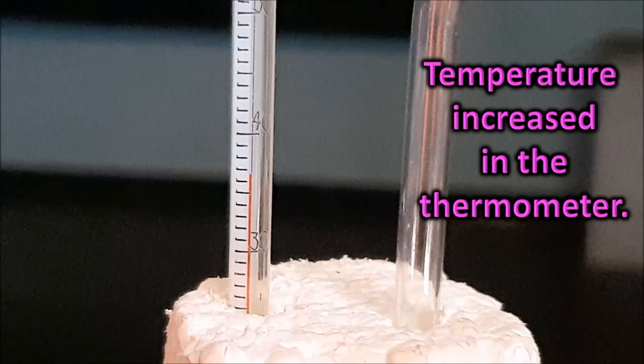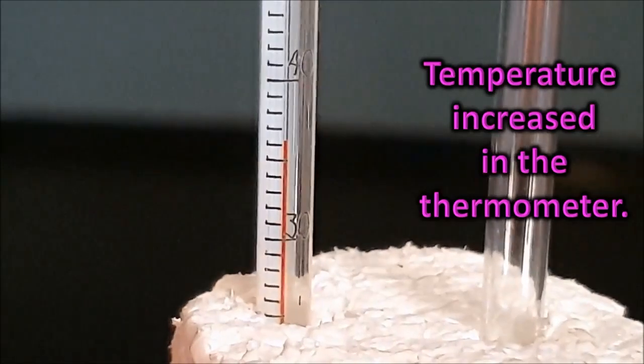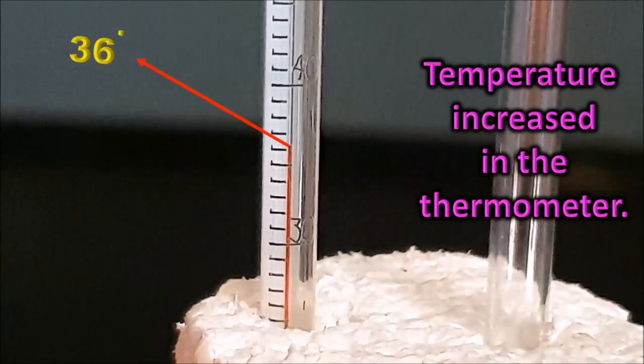After one day, the temperature is increased in the thermometer. Record the final temperature. So it is 36 degrees Celsius. So from this we can say that in anaerobic respiration in yeast, energy is released in the form of heat.